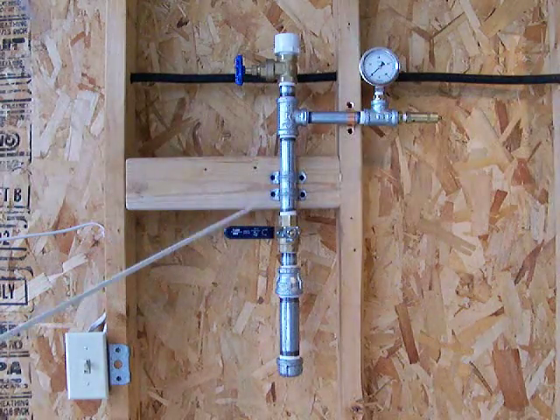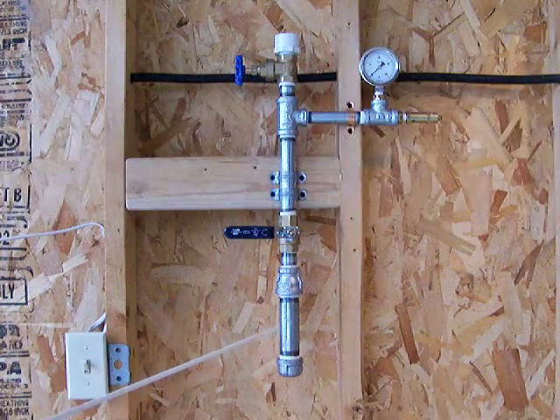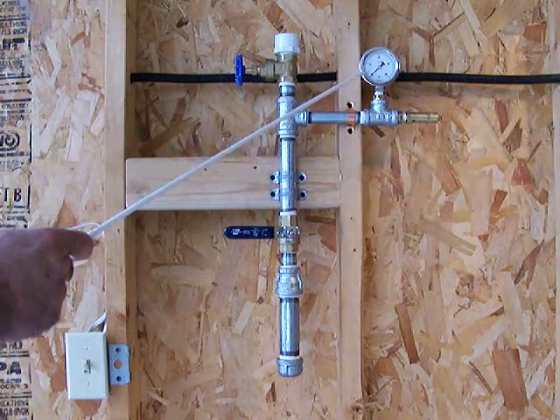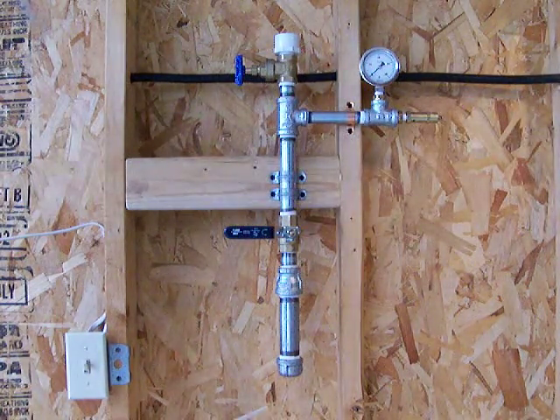I'm going to open this valve. The hydrogen peroxide is going to run down into the catalytic chamber and react with the catalyst. We should see a real quick increase in pressure and we can watch it on this gauge right here. I've got a 300 PSI safety valve just in case.